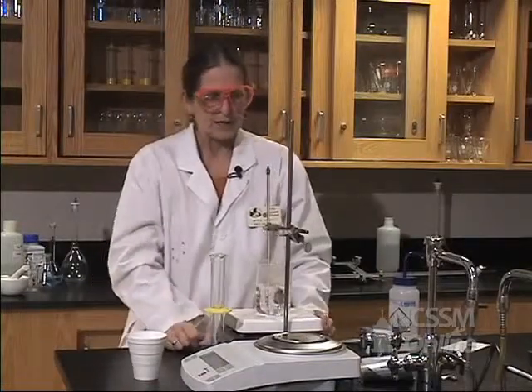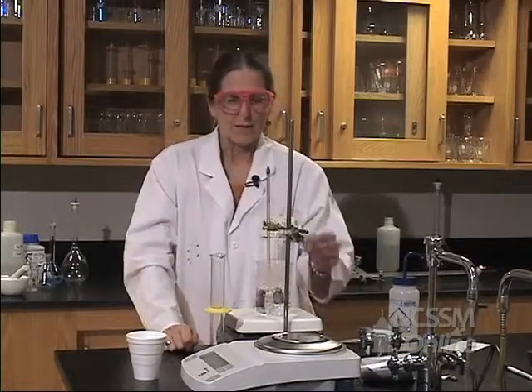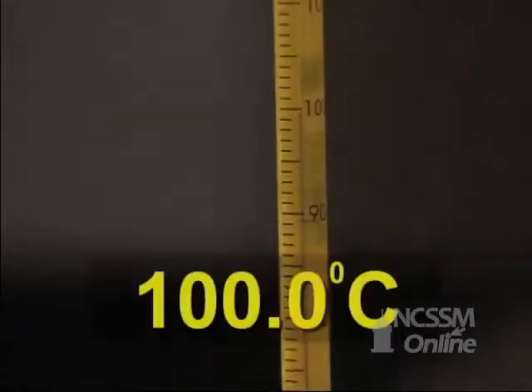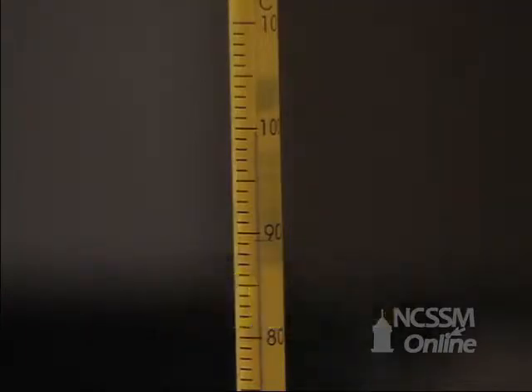Okay, and we're going to let this boil long enough that we know that the temperature of the metal is the same temperature as the water. I think we've waited long enough to be confident that our metal and our water are at the same temperature. Our temperature is exactly 100 degrees.